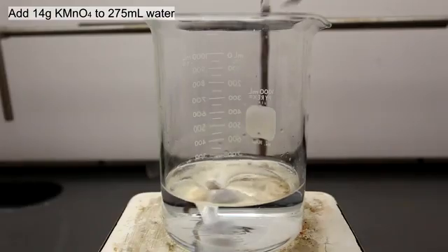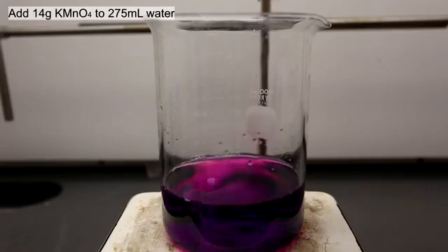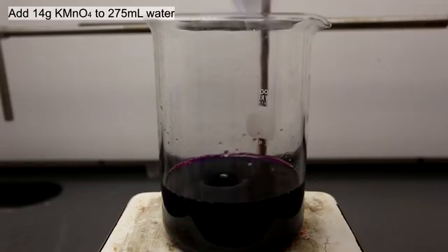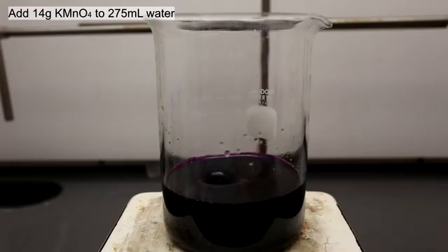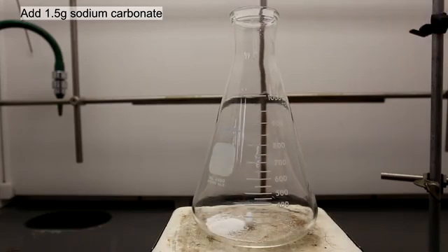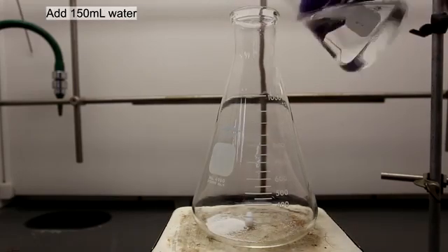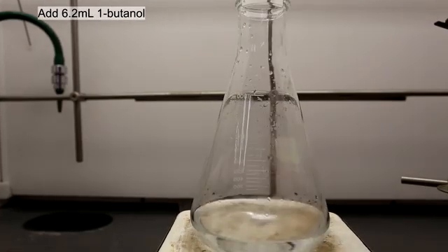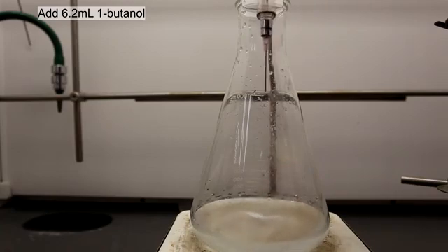First, add 14 grams of potassium permanganate to about 275 milliliters of water. To fully dissolve all the KMnO4, you might need to warm the solution a little. To a large 1-liter flask, add about 1.5 grams of sodium carbonate. Dissolve the sodium carbonate in about 150 milliliters of water. Finally, to the sodium carbonate solution, add about 6.2 milliliters of 1-butanol.